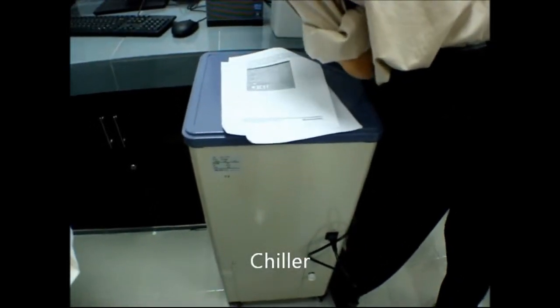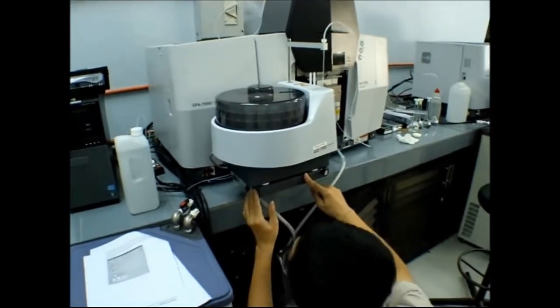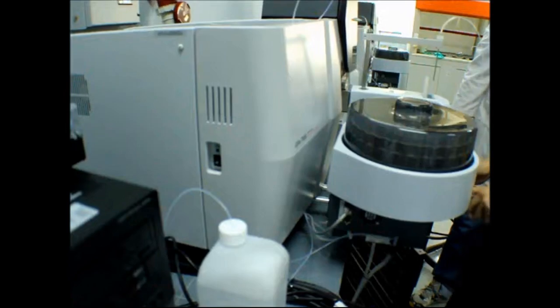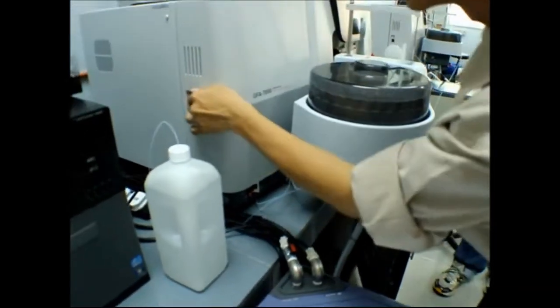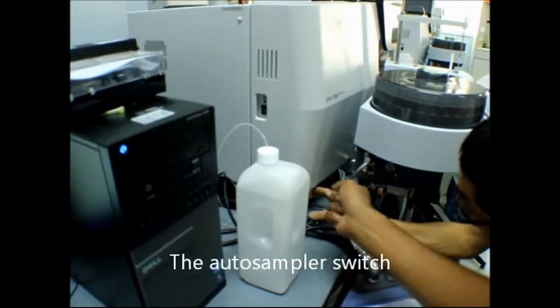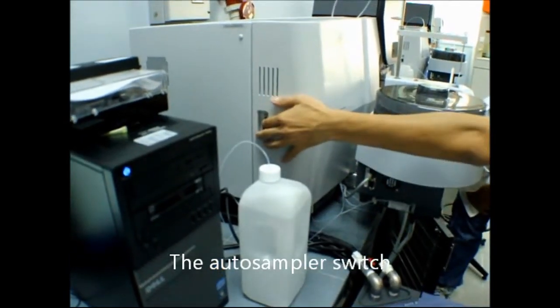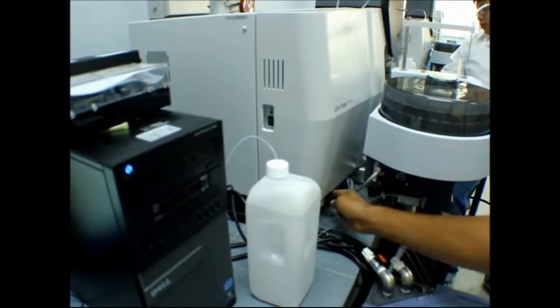Yes. Where is this switch? No light. Maybe on this here. I think I need to switch on this one.